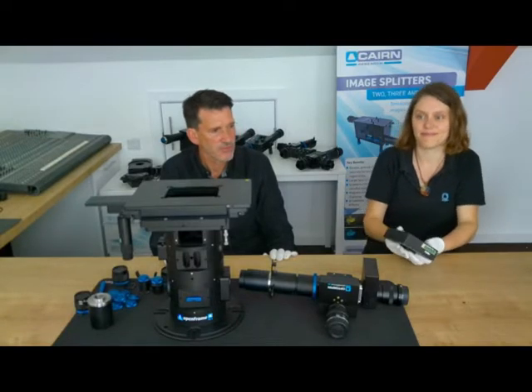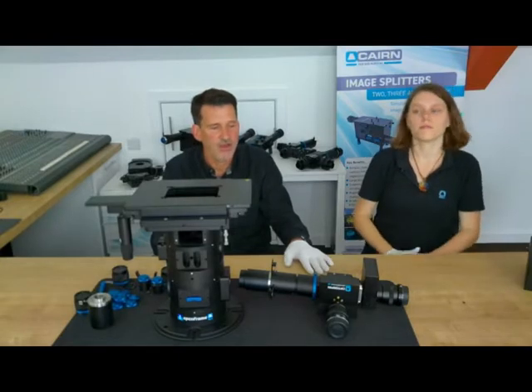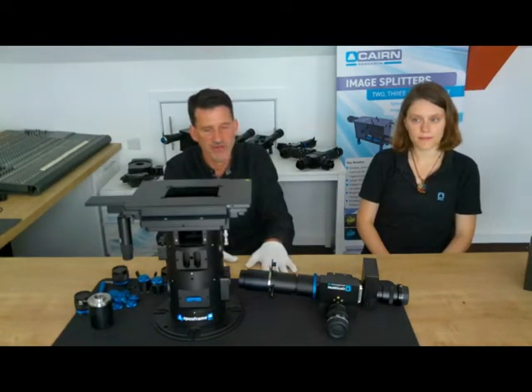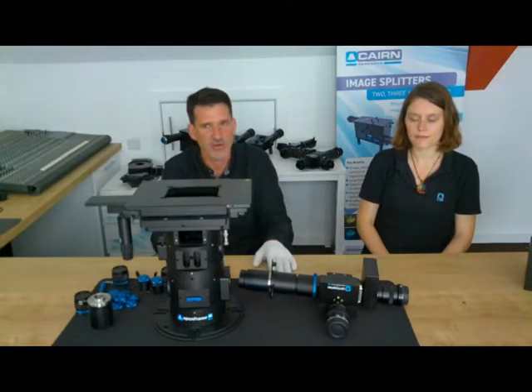sensors. So all these detection devices that we've just shown are designed to work around either openFrame or a conventional microscope. We're now going to talk about a couple of illumination devices and then show 1 or 2 modules that we've developed specifically for the openFrame architecture.